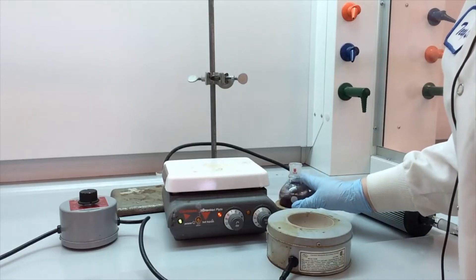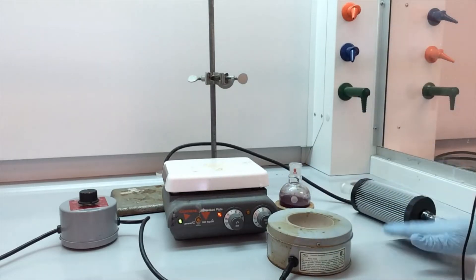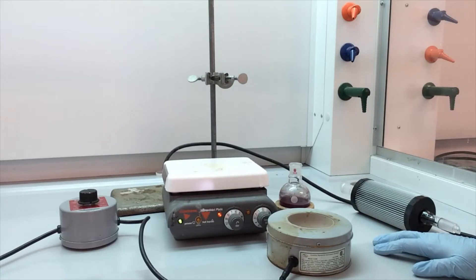Hello everyone! Today we are going to learn how to set up a reflux so that we can heat our reaction for a prolonged period.